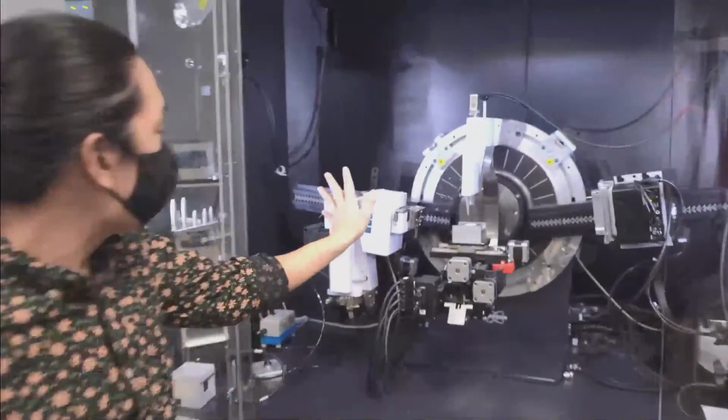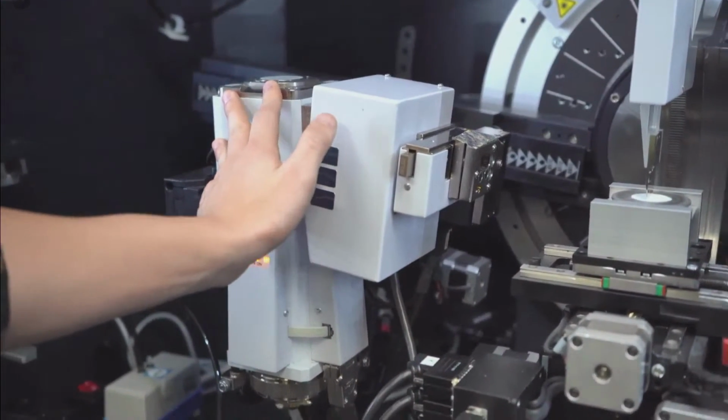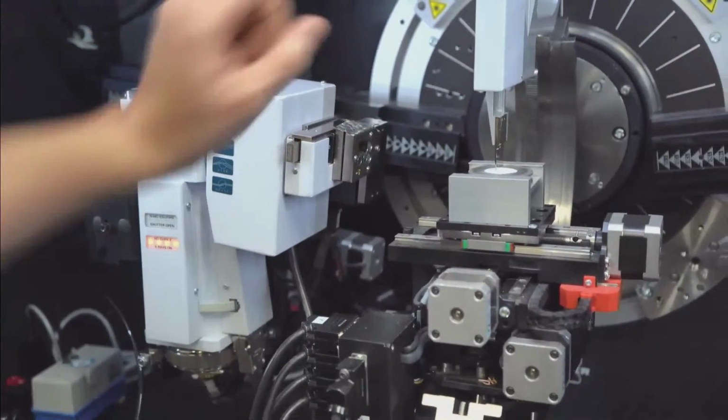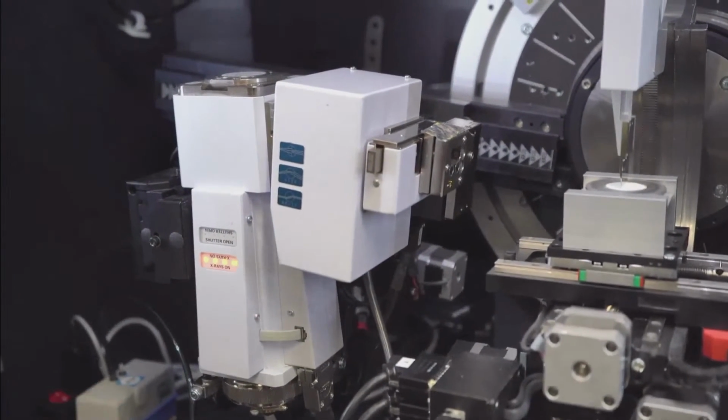So this is a copper sealed tube. Last month we talked a little bit about X-ray sources. Yep. This is the sealed tube. It is set up with a line focus, which means it's going to be shooting a line of X-rays down onto your sample. So a big, broad line beam. Yep, a big broad line beam to match the size of your sample surface.